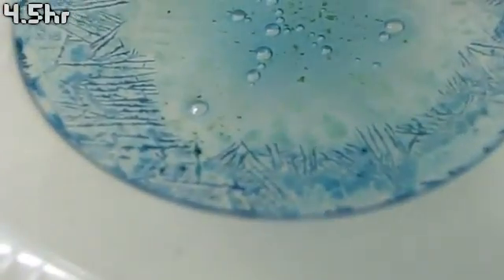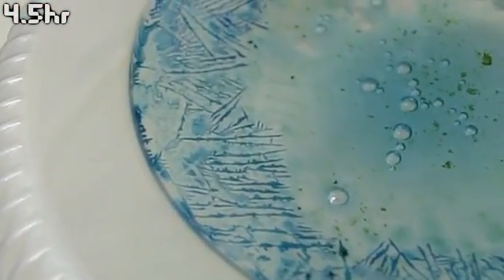You can see that as the solution evaporates away, it's creating some quite nice crystals. I really like how the copper acetate grows. It almost grows like ice crystals.